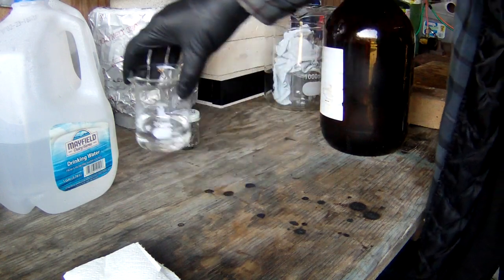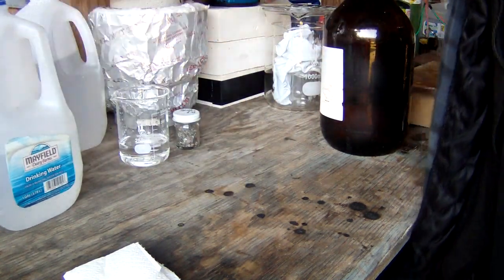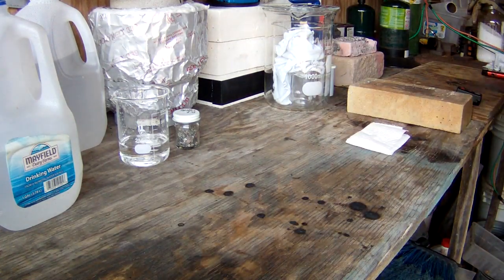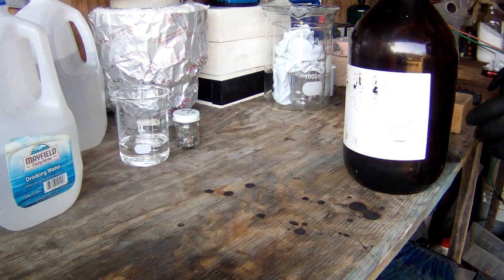of nitric acid there. I'm going to set it back to the side. I don't want to get that to spill on nothing. I'm going to go ahead and put our big jug up. When our distilled water gets just a touch warmer, we'll go ahead and add this stuff in, and we'll be ready to go. So we'll be back at you in just a few minutes.